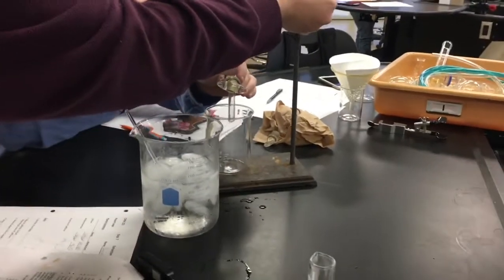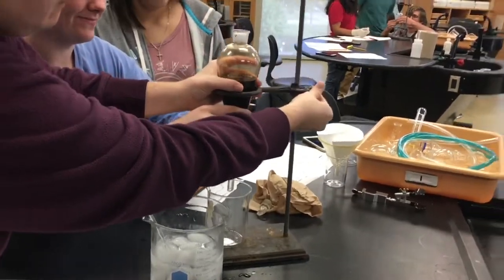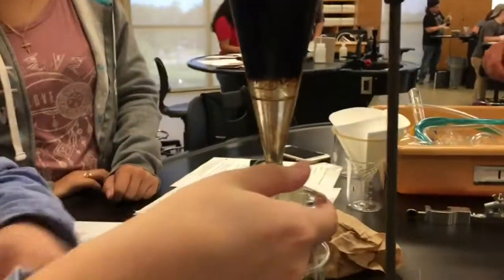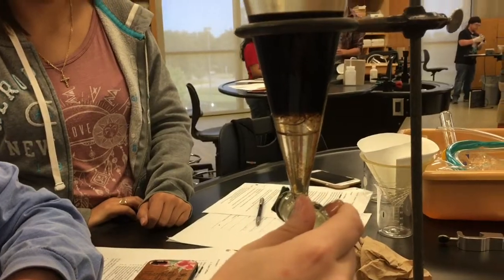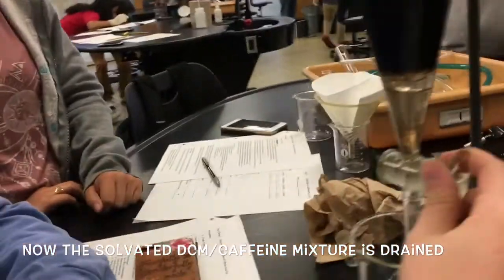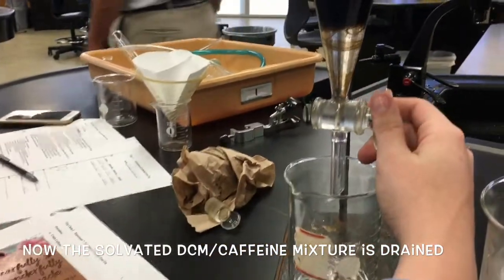This is where the real magic happens. We're lowering this — we've washed our glassware up. Yours is separated pretty good. Those older ones are a little skinnier. Yeah, it really is down at the bottom. It's just going down there. Very cool.